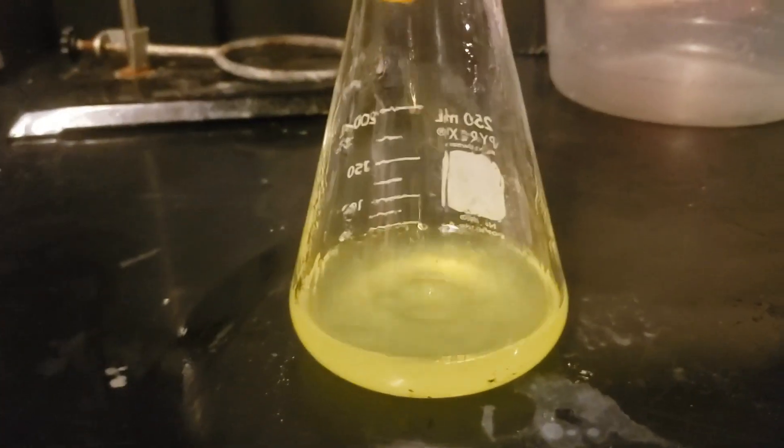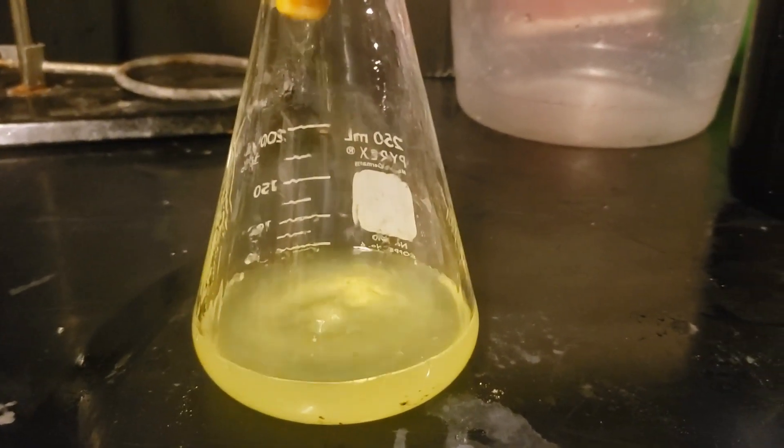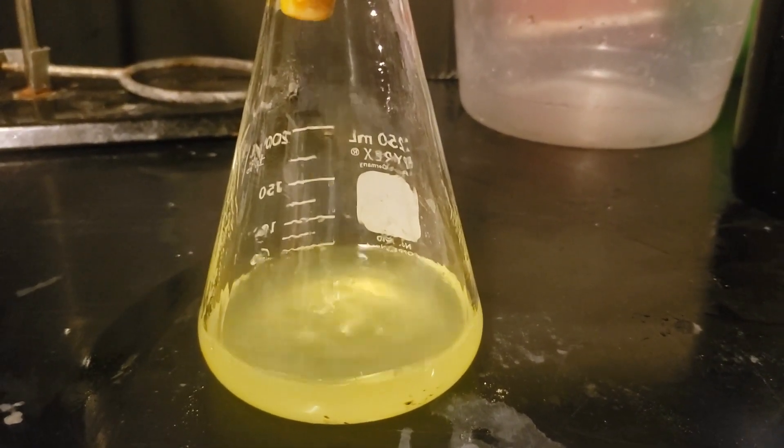A small amount of unreacted tetrabutyl ammonium octamolybdate was left over, so I filtered the solution quickly and washed the filter with about 20 ml of boiling hot acetone.